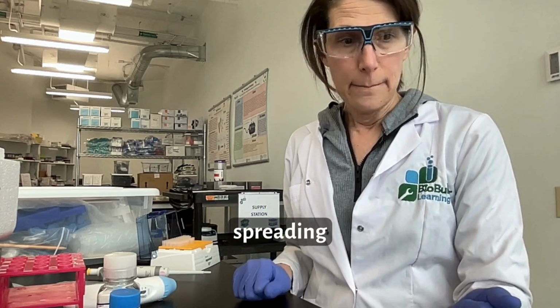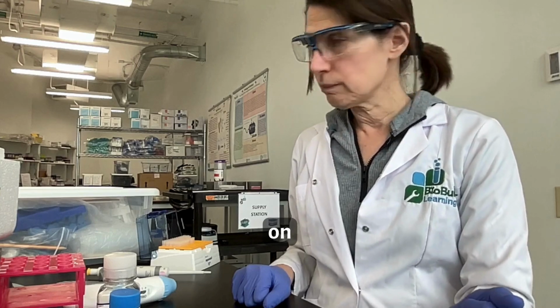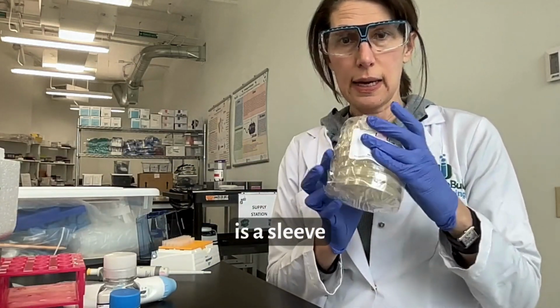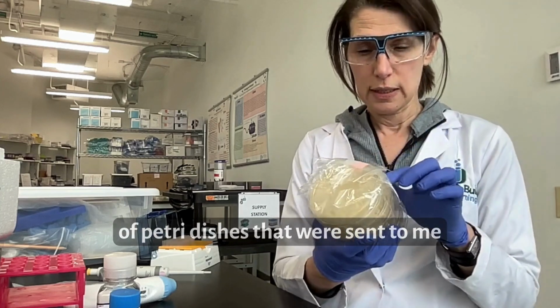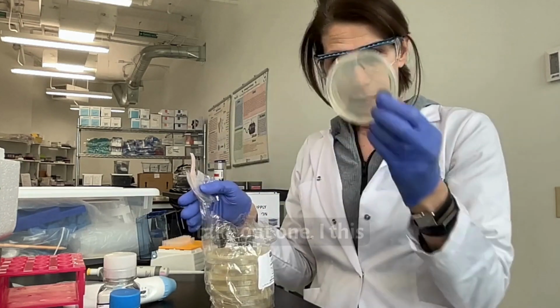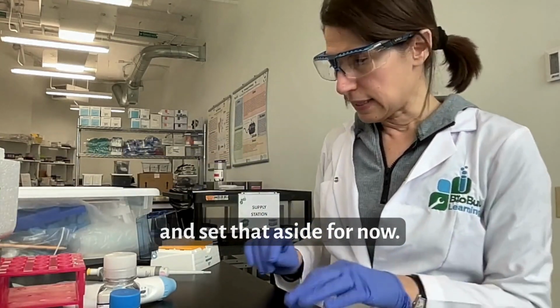Let's see, maybe first thing, let me demonstrate spreading on a plate. So here is a sleeve of petri dishes that were sent to me from Carolina. We used some of them, not all of them, so the rest were taped closed, but I will open and take out one and reseal this and set that aside for now.